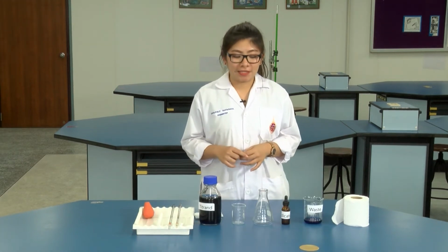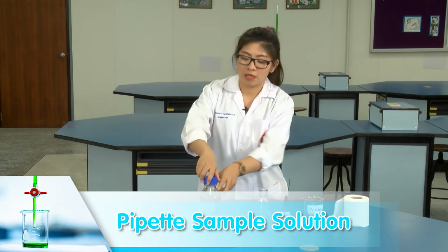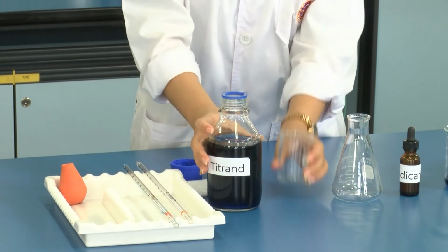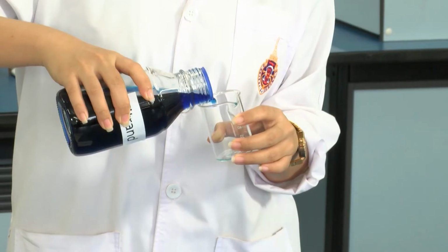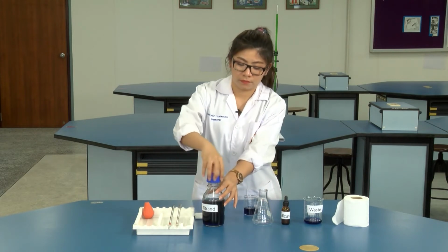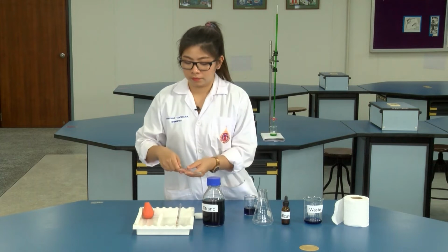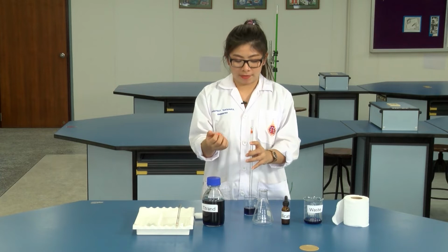To pipette the sample solution, transfer the sample solution into another beaker. And then use the pipette.